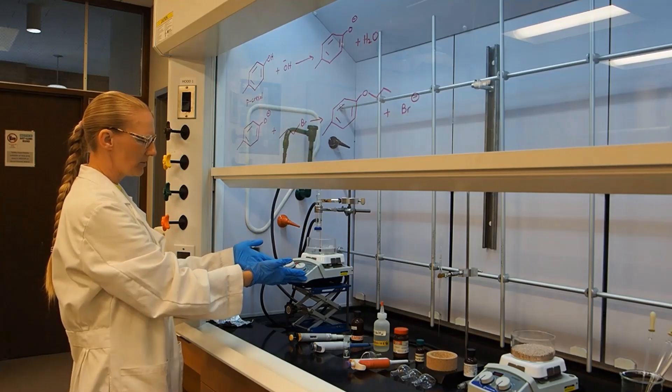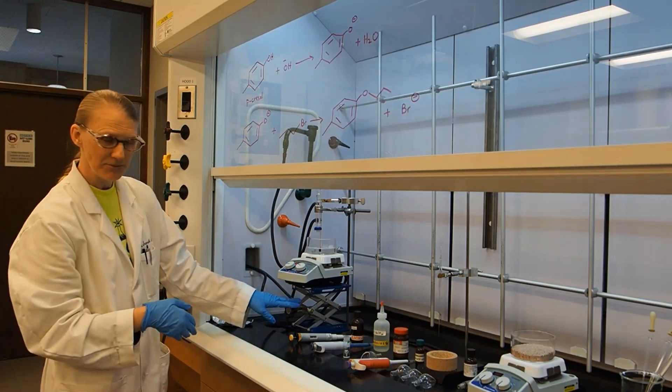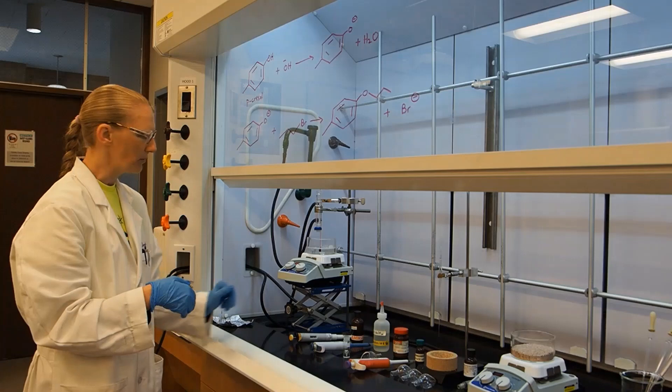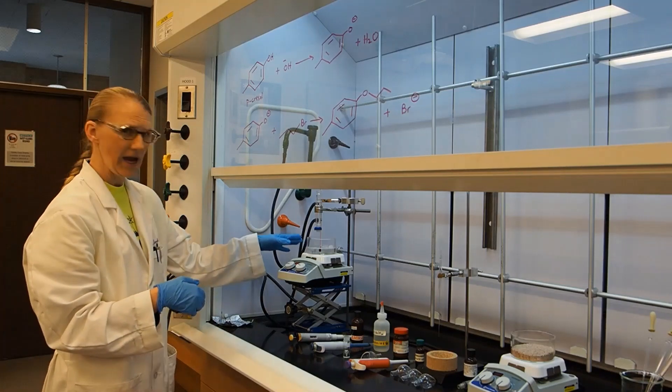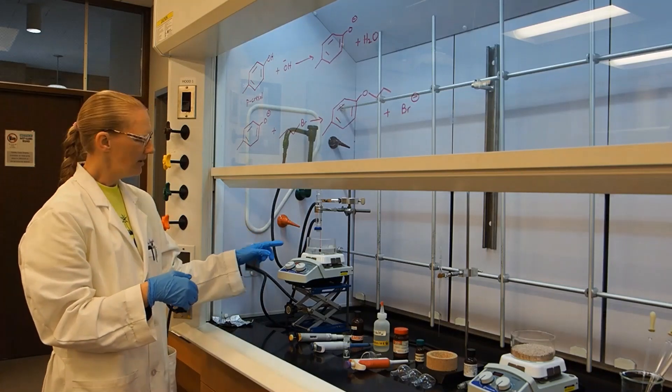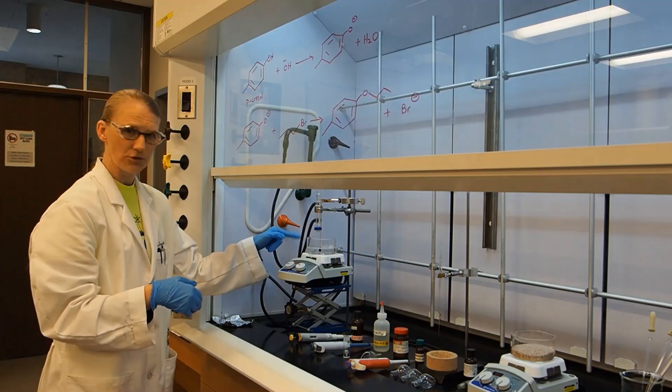I have a heater stirrer set on a lab jack that is already up so that I can lower it later. I have an oil bath with a large paper clip for a stirrer. The stirring is already on.